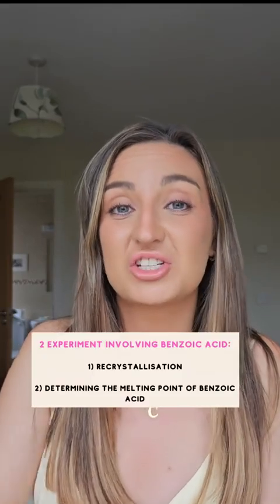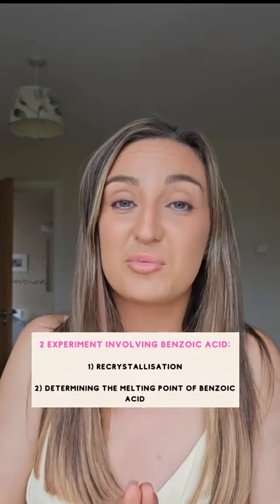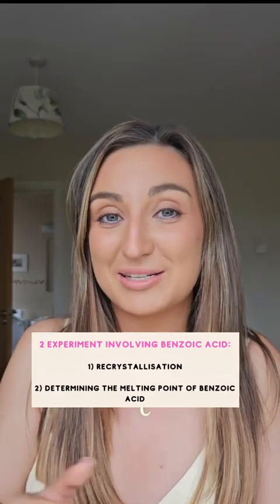What is recrystallization? So we're starting off with a mixture, okay? And some of this mixture is benzoic acid and some of it is impurities. An example of an impurity you could use is charcoal. We're going to use a technique called recrystallization to purify our sample of benzoic acid. I'm going to test to see how good we were at purifying our benzoic acid out of the sample by determining its melting point. So let's start with step 1, recrystallization.